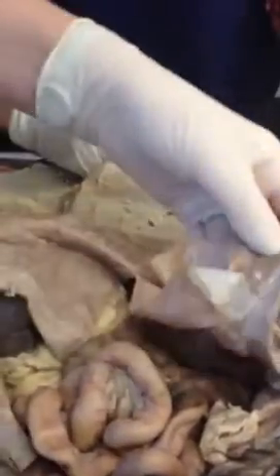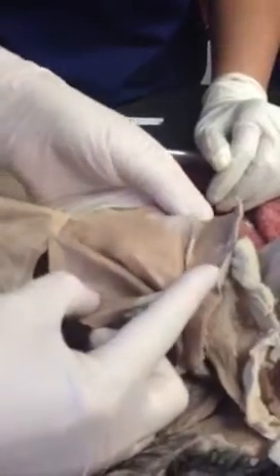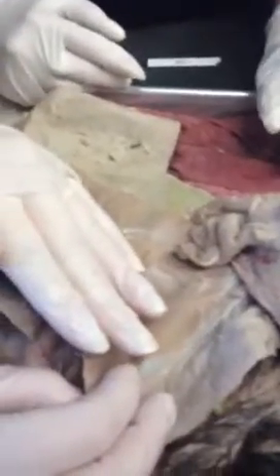Looks like we actually can see some on your specimen. Let me see, I'm going to cut this away a little bit to see if we can get better visualization. It's just hard for me to tell, but the internal abdominal oblique is just immediately deep to the external abdominal oblique, but its fibers run cranioventral.